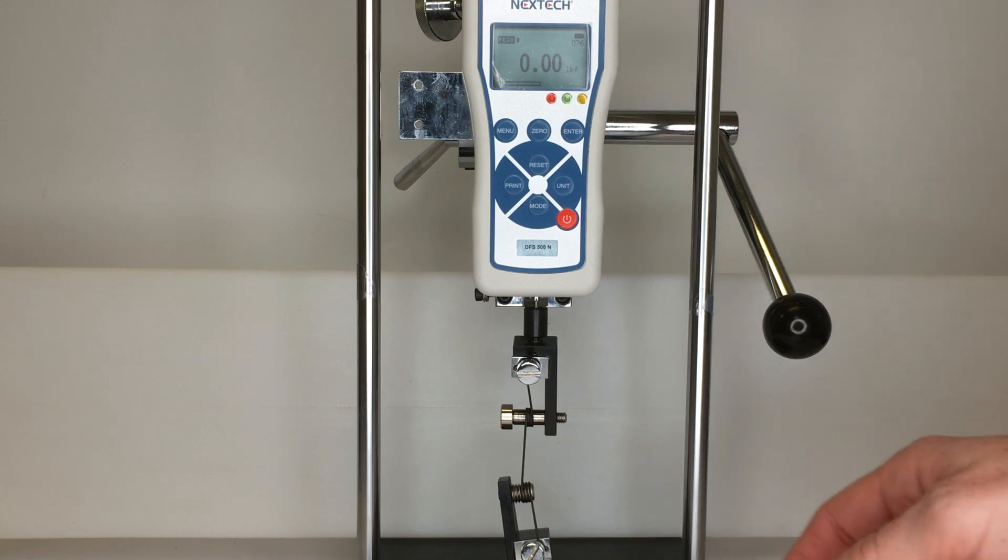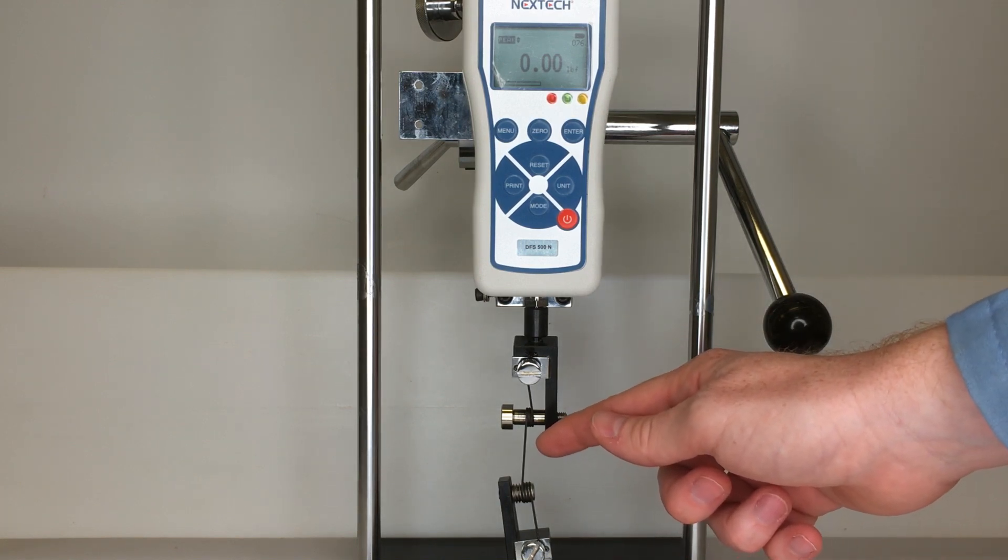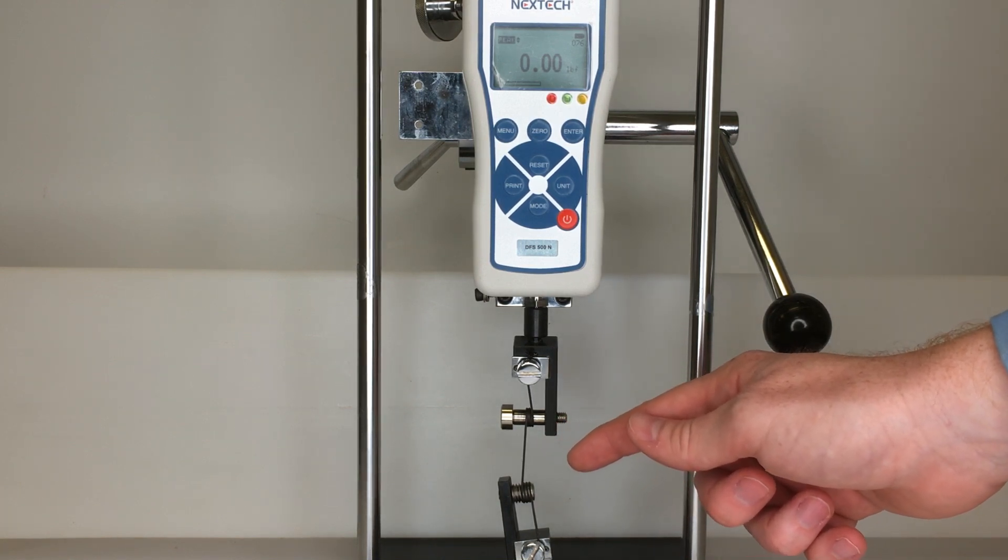What you can see here is that we have a one millimeter diameter yarn loaded onto this tensile strength testing apparatus.